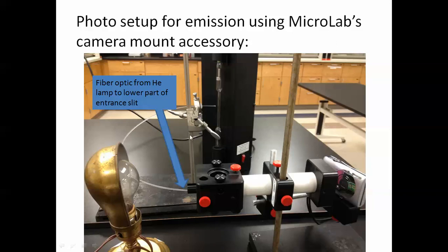Notice the fiber optic cable. Fiber optic cable takes the light from the helium emission tube into an adapter at the base of the slit, so that the visual field sees not only the spectrum from your emission source that you want to view, but you also see the lines from the helium spectrum that you can use in order to carry out a wavelength calibration. So you go from a qualitative spectral observation to the capability of having quantitative wavelength displays.